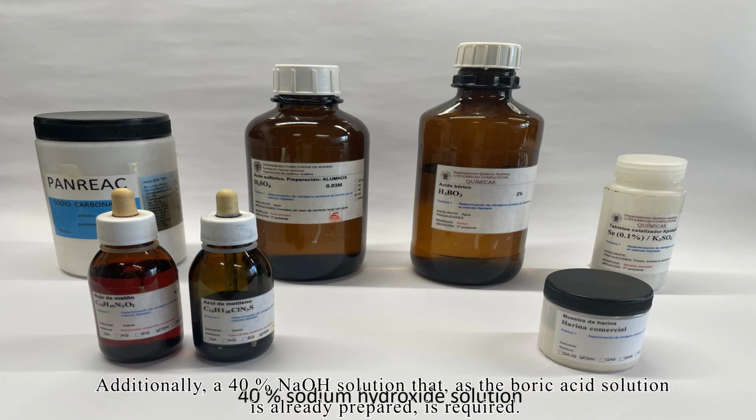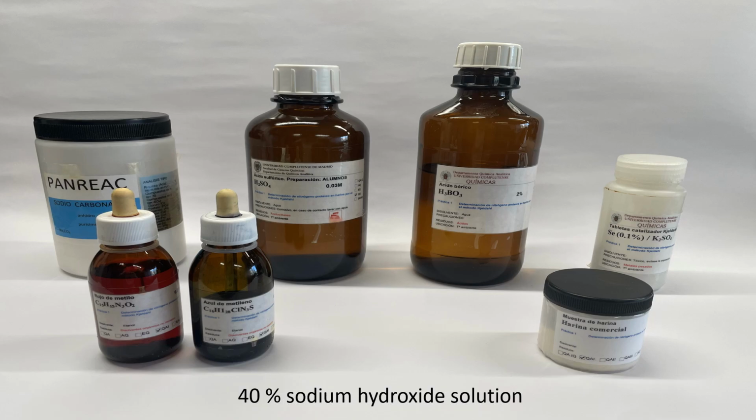Additionally, a 40% sodium hydroxide solution that, as the boric acid solution is already prepared, is required.